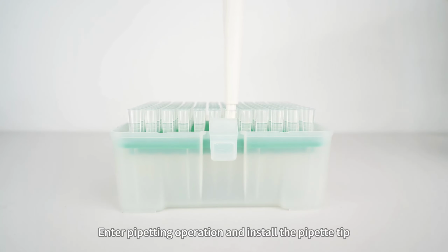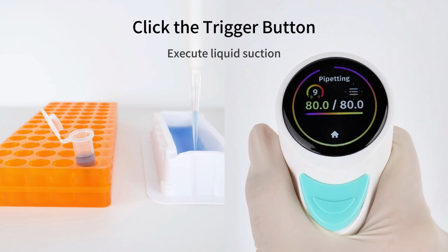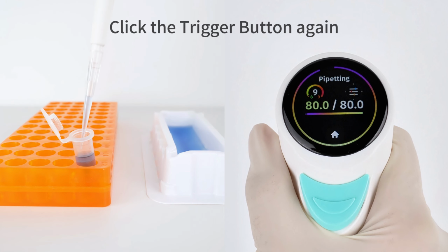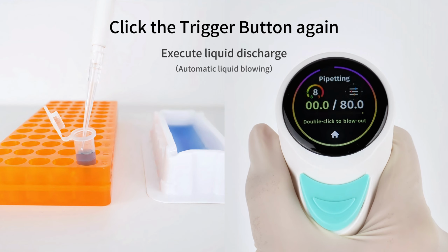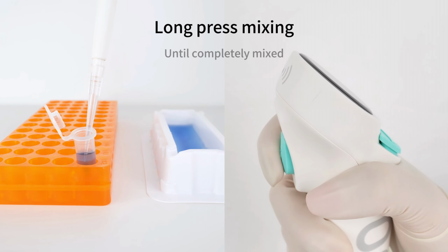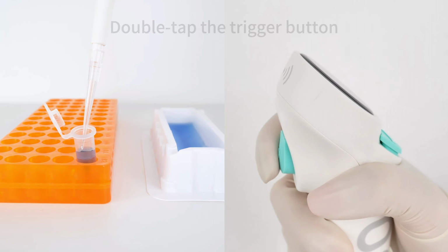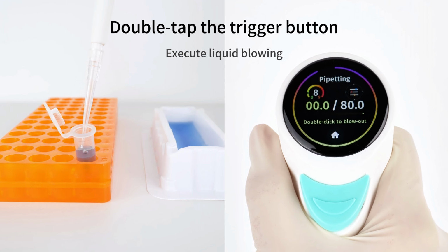Enter pipetting operation and install the pipette tip. Click the trigger button. Execute liquid suction. Click the trigger button again. Execute liquid discharge. Press and hold to mix as necessary until completely mixed. End of mixing. Double-click the button. Execute liquid blowing.